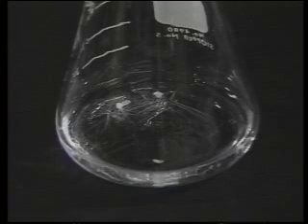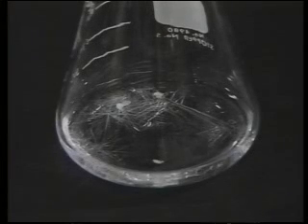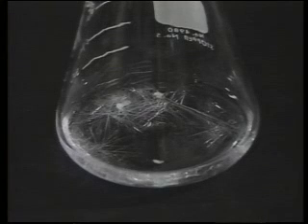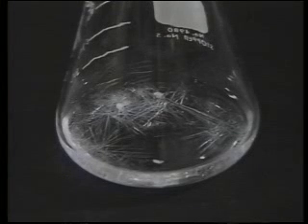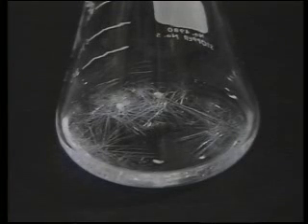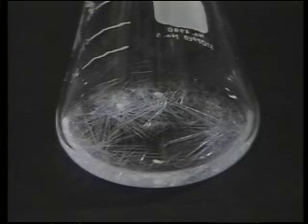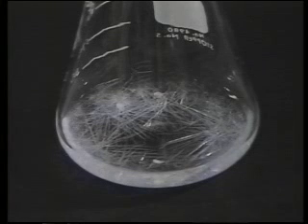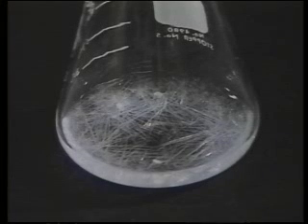The Nobel laureate, the late Professor Robert Burns Woodward, in his essay, Organic Compounds, Retrospect and Prospect, stated that crystallization is one of the most beautiful processes known and no true chemist fails to experience a thrill when he brings a new form of matter into the crystalline state for the first time. Often, this is a very difficult process requiring great practical skill and persistence. In this and other practical respects, Organic Chemistry is a craft, and the more craftsmanlike the approach to it, the more it is likely to be successful, and like all things made with care and affection, beautiful.